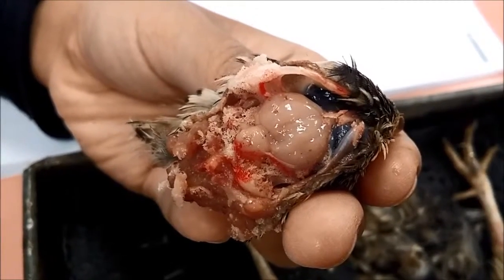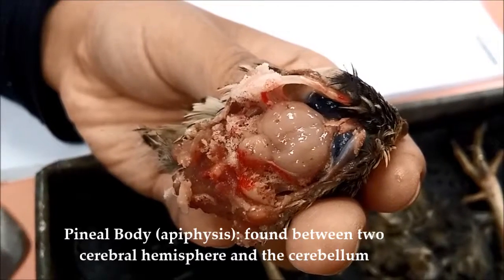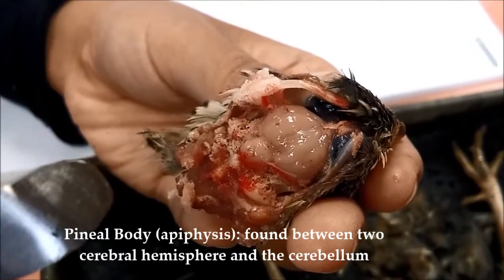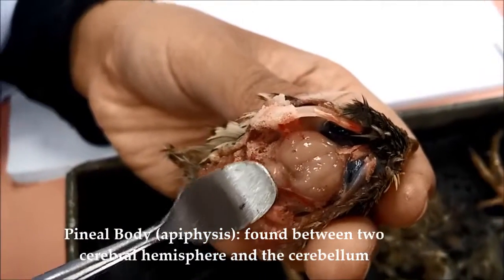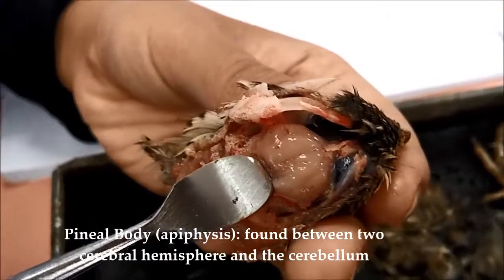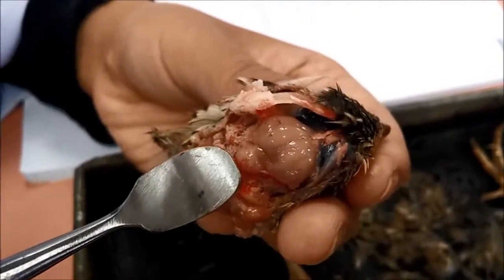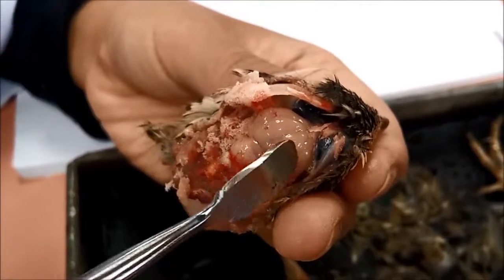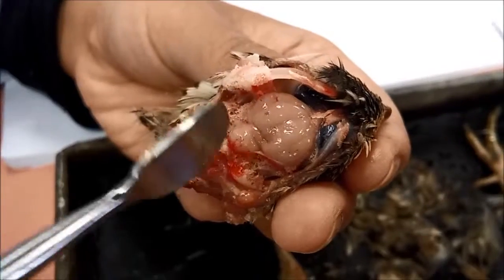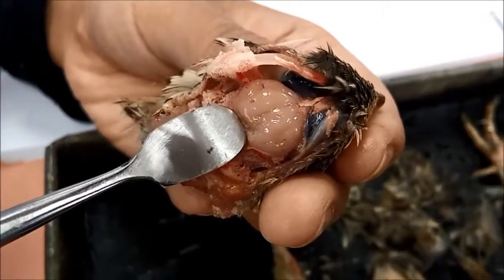Third, the pineal body, which is also known as the epiphysis. The pineal body is here, the small thing here. You can see it clearly. So basically the pineal body is found between the two cerebral hemispheres and the cerebellum. So this is the cerebral hemisphere. This is the cerebellum, and at the center is the pineal body.